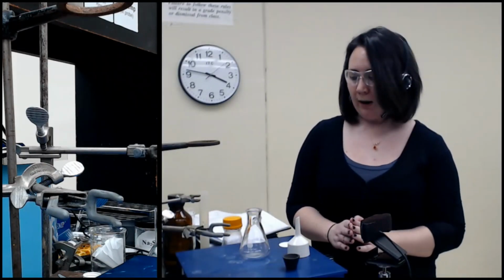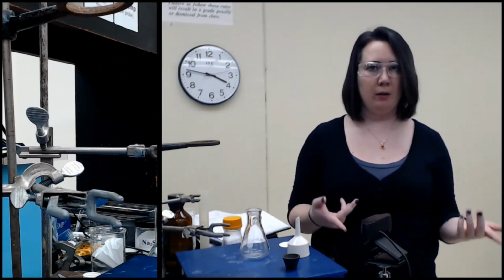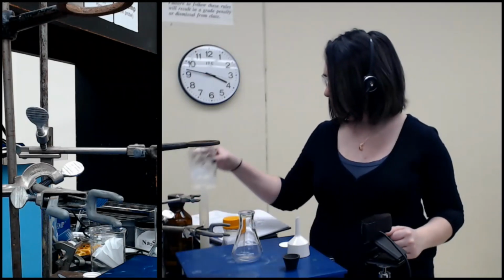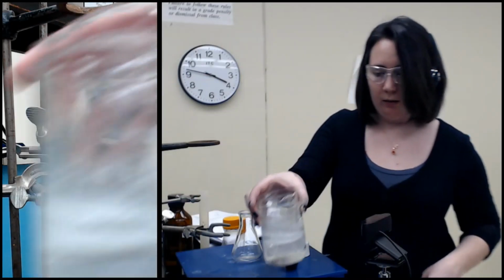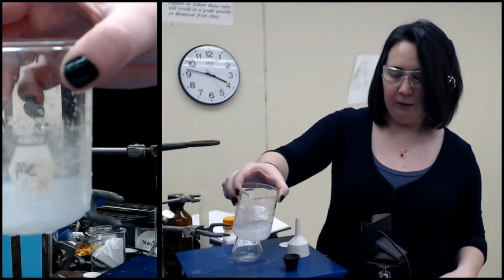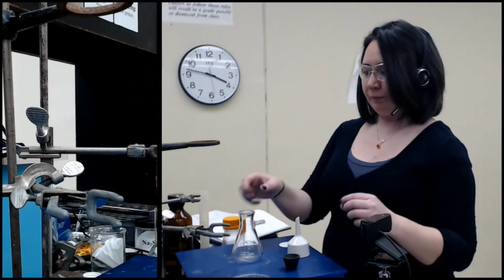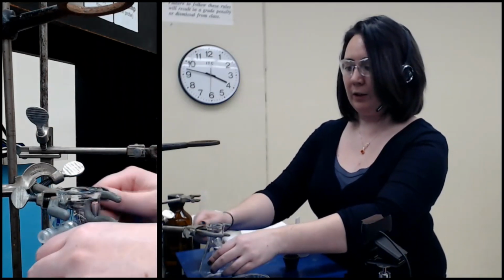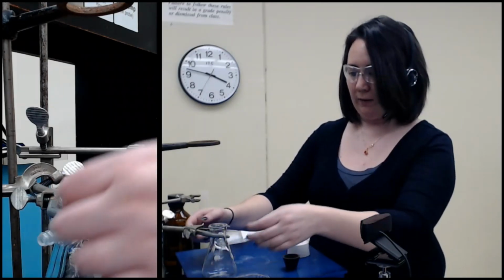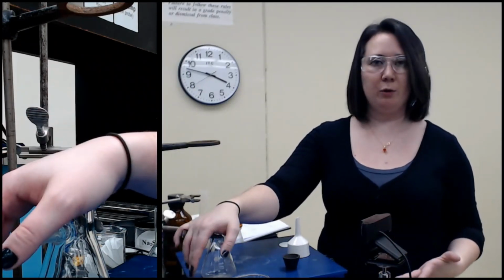Okay, so while the Rotavap is removing the ethyl acetate from our other sample, I am going to vacuum filter to collect our solid from the aqueous layer. You can see a fair bit of solid has formed, and I'm going to collect that with vacuum filtration. It's a bit too fine for gravity filtration. It's also water, so we would be sitting forever. So we're going to do vacuum filtration. It's much more efficient, and it will also help dry the solid.